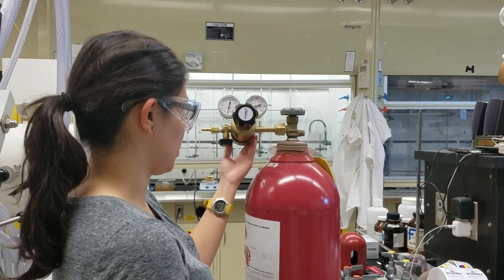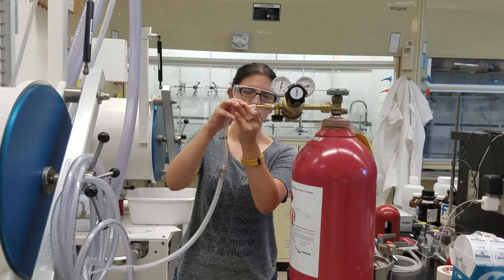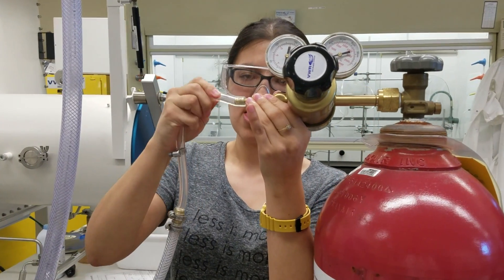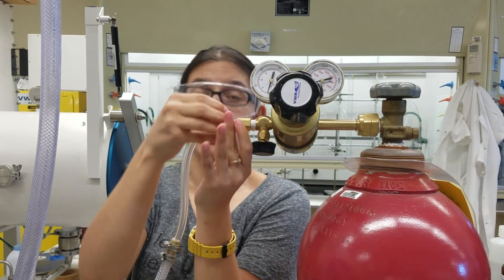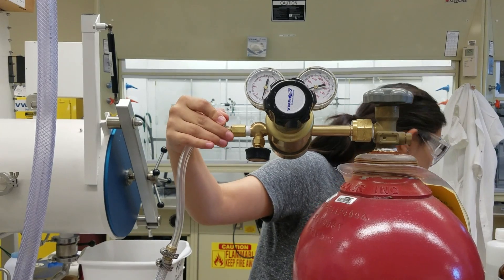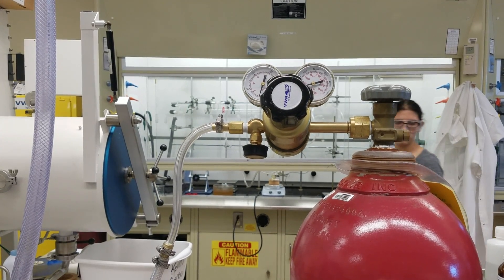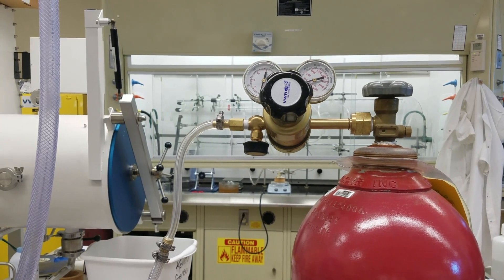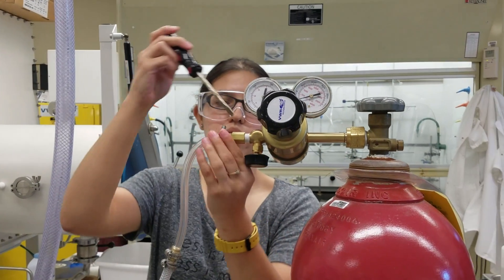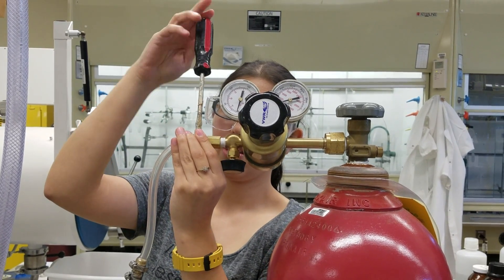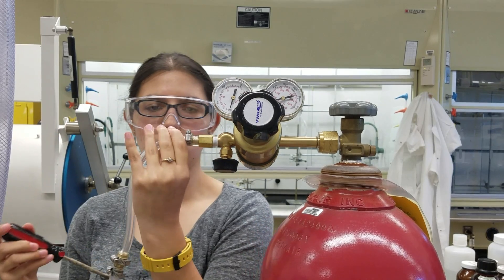Okay, so that bit's set up and then you have to connect this piece of tubing to the other part of your regulator. And that you can do like that. We have a clip to make sure that this stays in place and doesn't fly off, because you don't want to fill the lab with gas. So that's one thing I don't have. So this is secure, it's not going to pull off.